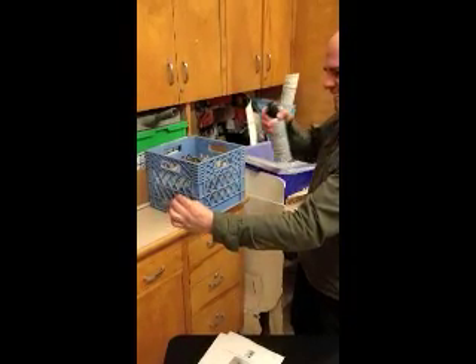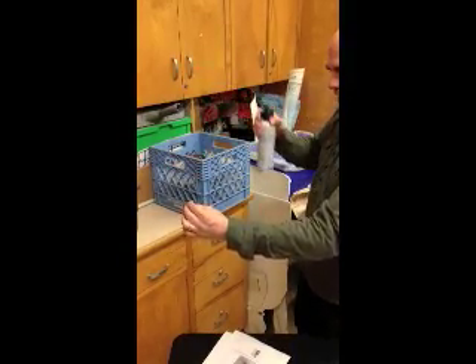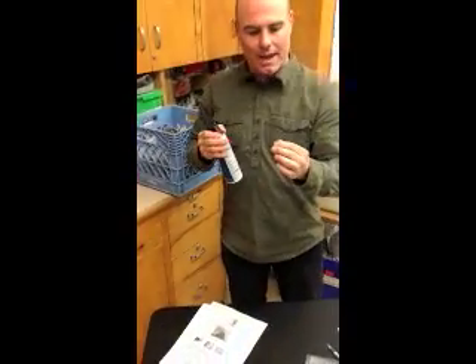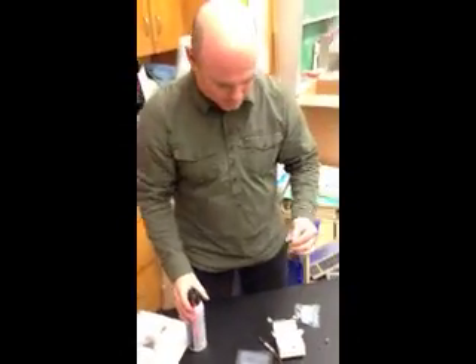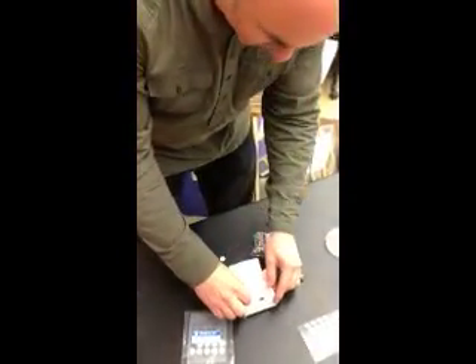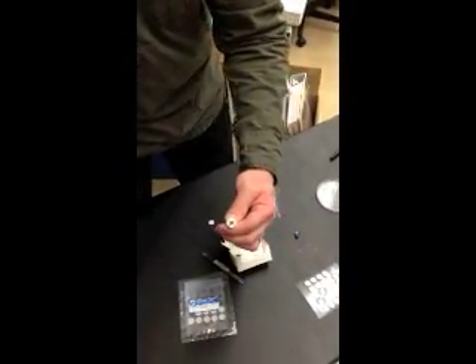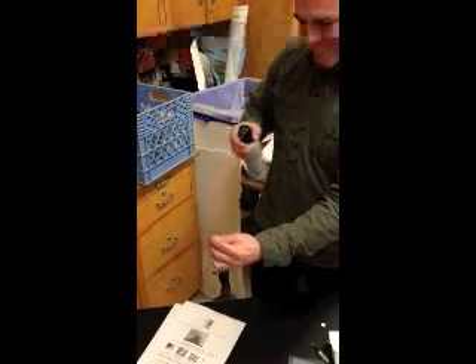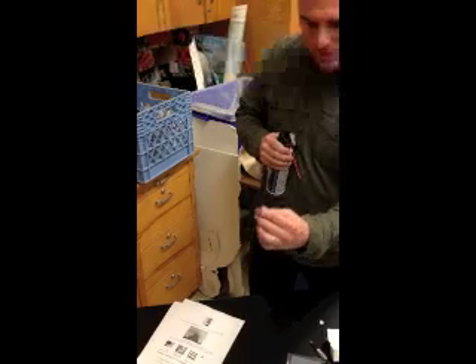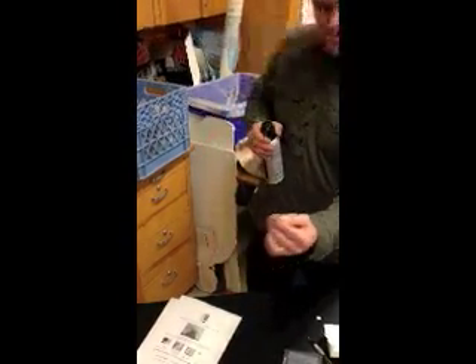So I'm going to come around here and do it a couple times. Notice nothing has come off. The teacher may ask to blow it off again one more time just to make sure, and then it's ready. Let's go see if this other one is now ready. You can tell it's dry because it's like a lighter gray. Now this could blow off and there's always an issue. So one of the mouthpieces did blow off, but the eyes are still intact. I'll do it one more time. Looks like it's in good shape. Alright, we're ready to scan.